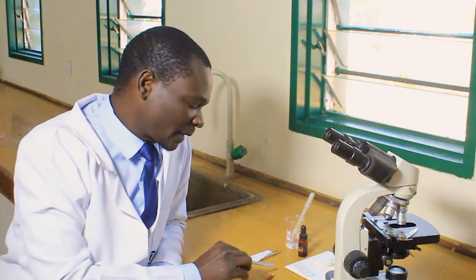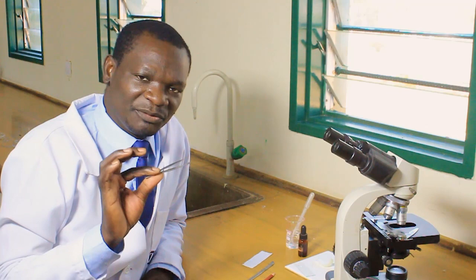First of all, the most important apparatus you need is a microscope — a light compound microscope. The next item is something to cut with, which is a scalpel. If you don't have a scalpel, a knife or a razor blade can still be used. You also need a tweezer or forceps. If you don't have those, your fingers can still do the job.